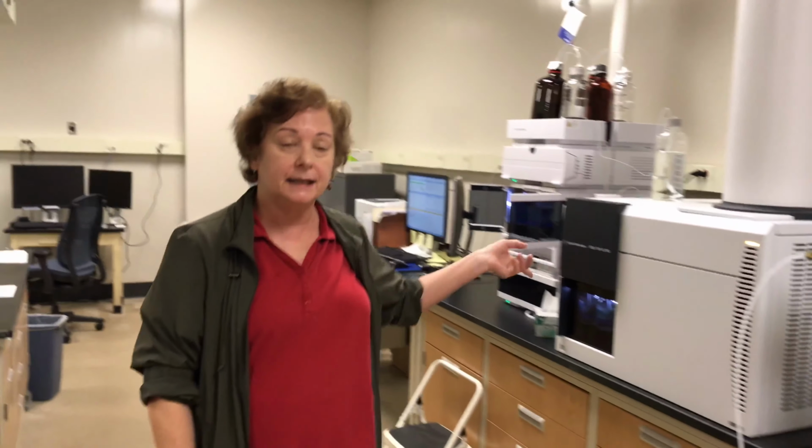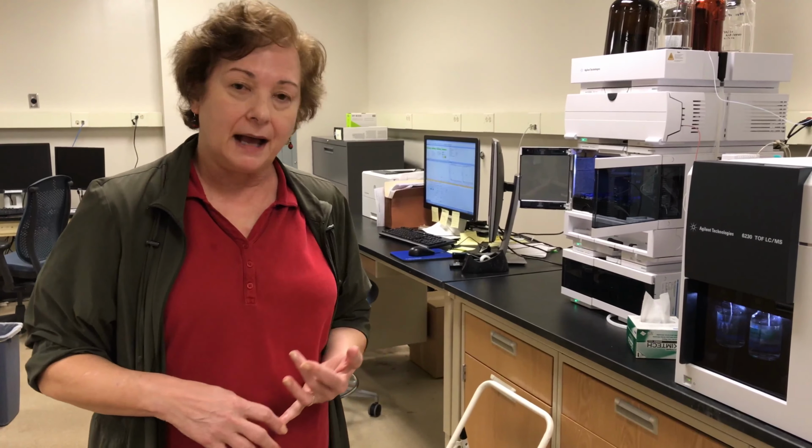And the instrument that you would be using is this ESI TOF, or electrospray ionization time of flight instrument. It's an accurate mass instrument, so especially if you're an organic student in our department, you would be submitting your samples here for analysis and verification that you did synthesize the compound you were trying to synthesize. I can generate formulas from a spectrum, and you can use this information for publication purposes.